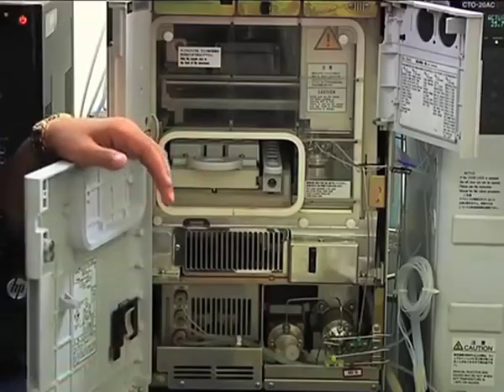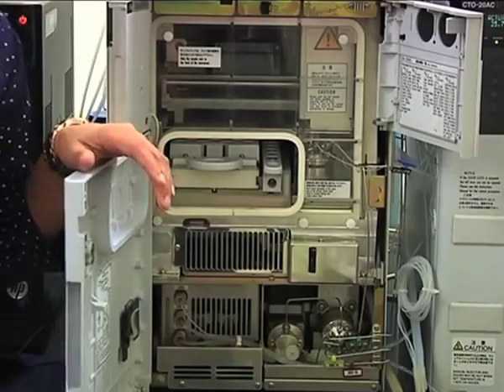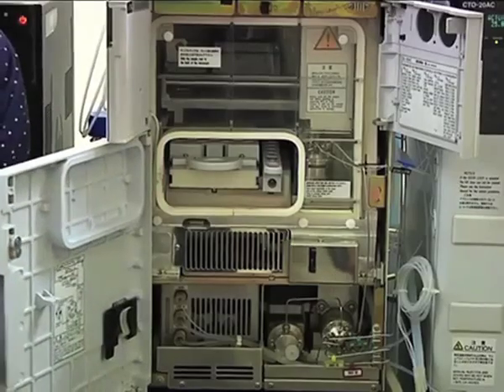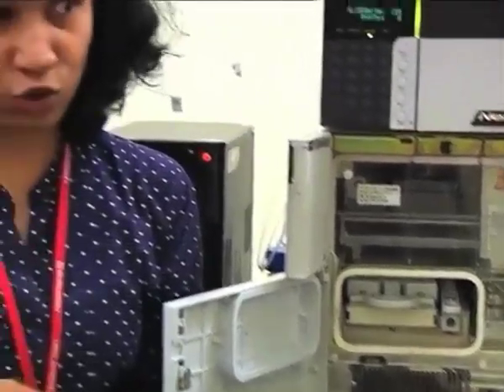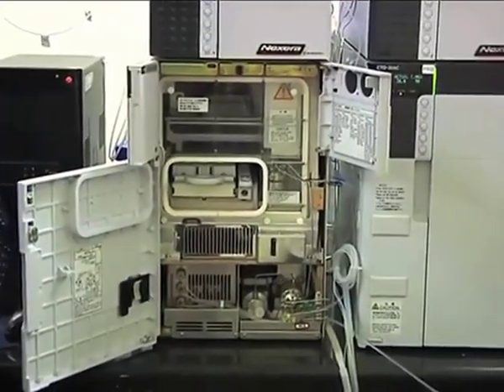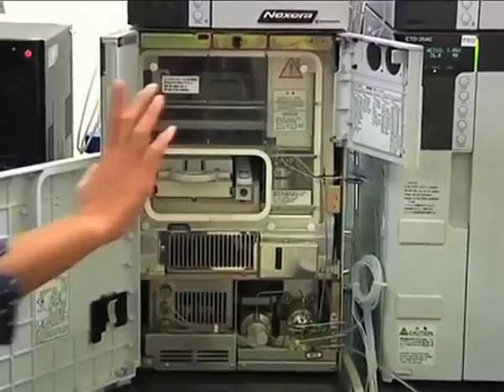Now what is the function of the low pressure valve? Suppose you have a manual injector. When you inject 2 different samples, in between the samples you perform rinsing of the needle or rinsing of the syringe, so that there will not be cross contamination, right? So when you are using an auto sampler, that function also needs to be done automatically, and that is the purpose of this low pressure valve. So in between the analysis, whatever rinsing and everything happens, that happens because of the low pressure valve.